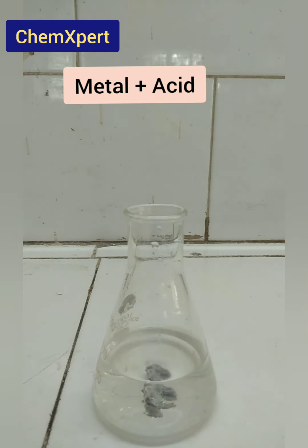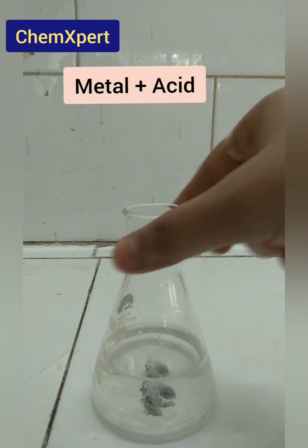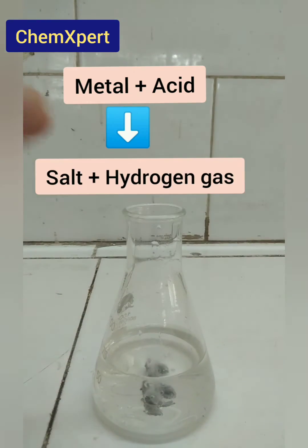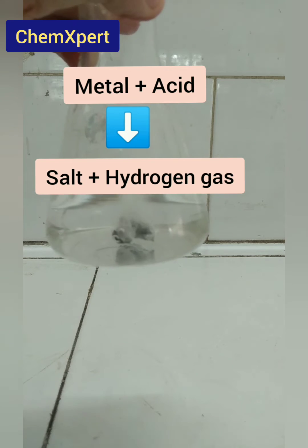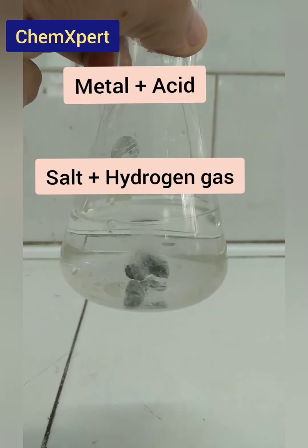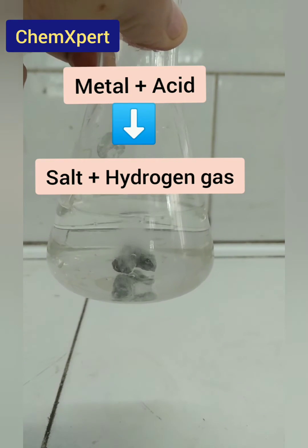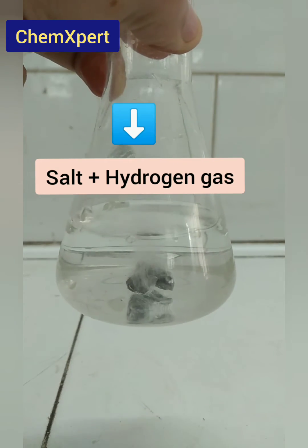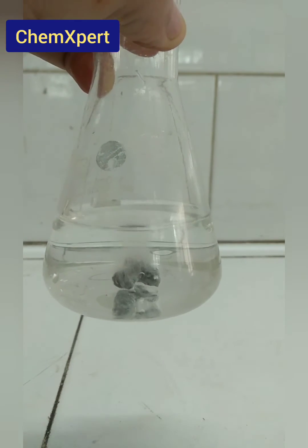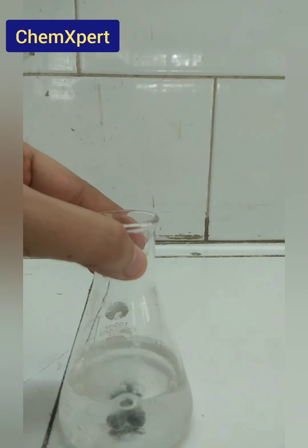What happened when metal reacts with an acid? You can see there are bubbles forming — that is hydrogen gas being released. This is a very vigorous reaction. It forms a salt and hydrogen gas is released, which is clearly visible through the bubbles formed in the reaction.